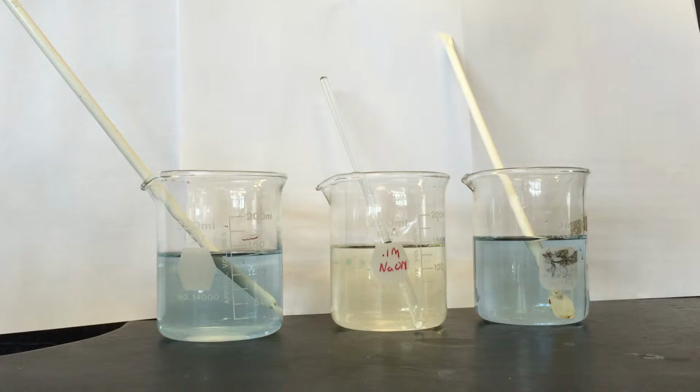The first beaker was originally a teal-greenish color, which indicated that the solution is at a neutral pH of around 7. When we first added hydrochloric acid, the solution turned a yellowish color, meaning that the pH was lower than 7, thus indicating that hydrochloric acid is in fact acidic. Note that this color change occurred when only about 15 drops of hydrochloric acid were added, meaning that only a small amount of the acid is needed for the reaction to occur.